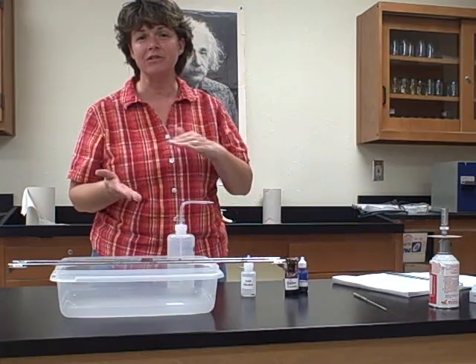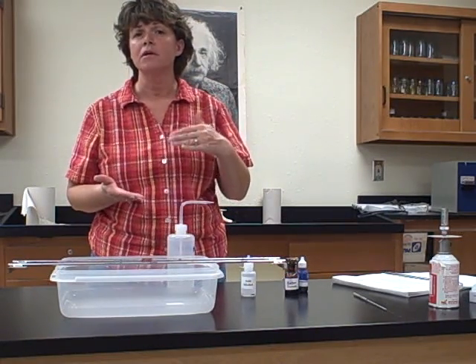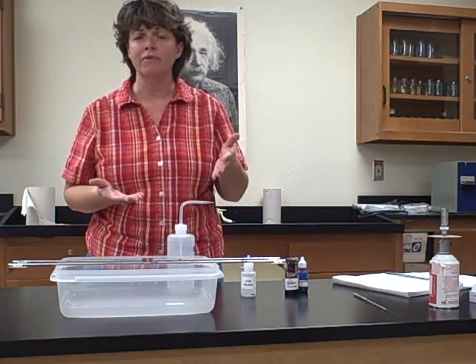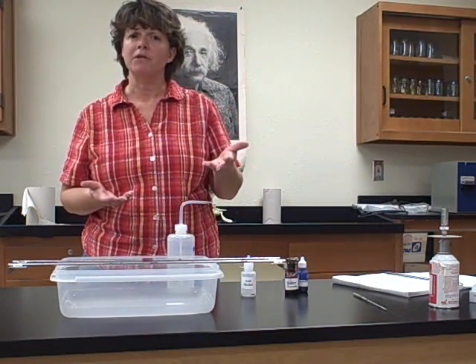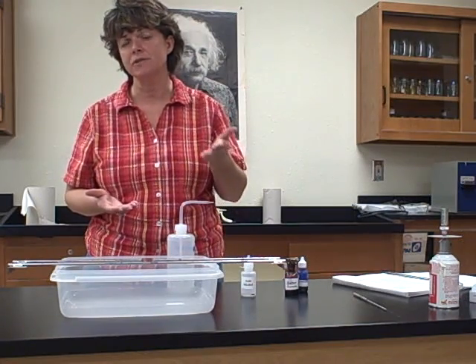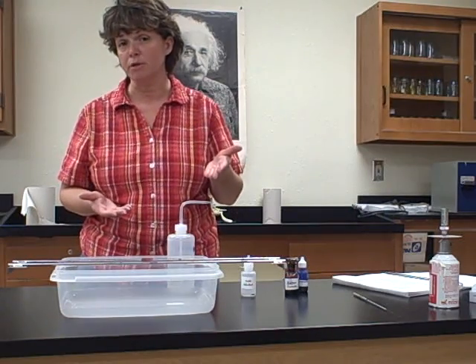Now, these acid-fast bacteria are that way because they have a waxy coating in their cell wall called mycolic acid, and they're impermeable to most stains. So you could do a Gram stain on them, and they probably look positive because they retain that primary stain, but you wouldn't be able to classify them as acid-fast. So they can't be stained by normal means for a diagnostic purpose.